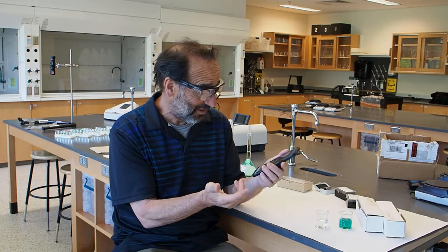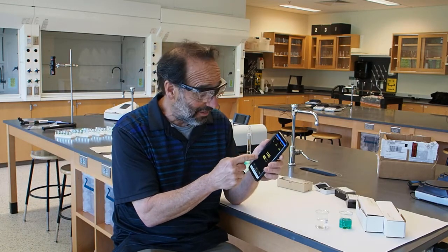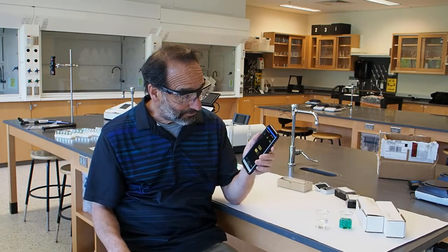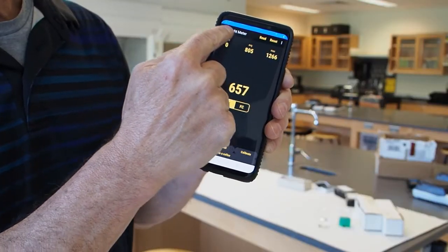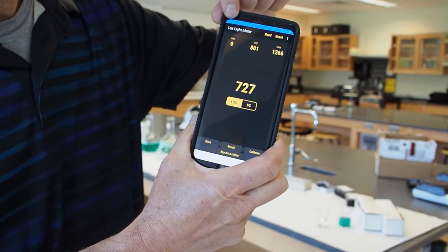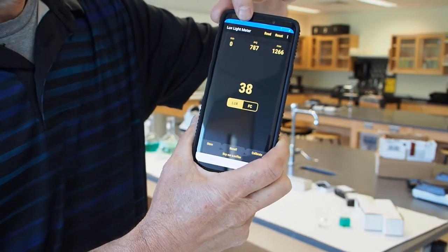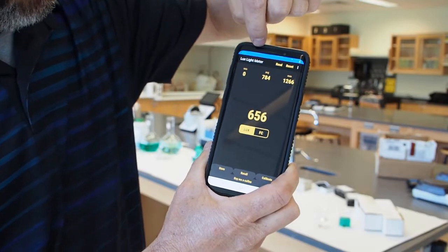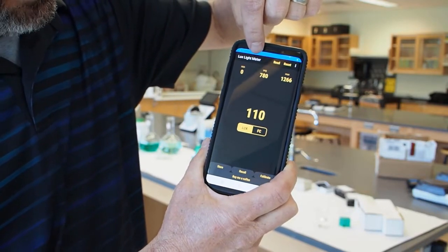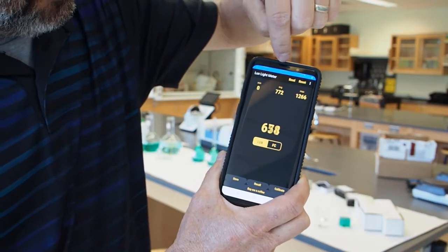So the first thing I'm going to do is find where the light sensor is. What you can do is run your finger over your phone until you see the light get blocked. And it turns out it's right at the top here. If I go right along the top here, right there, see that? It goes down. If you get the light on it just right, there's a little area right there where the light is blocked. So that's where my light sensor is, just to the left of the speaker. And so what we're going to do is make a little spectrometer out of my cell phone.